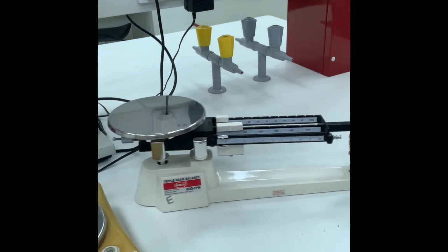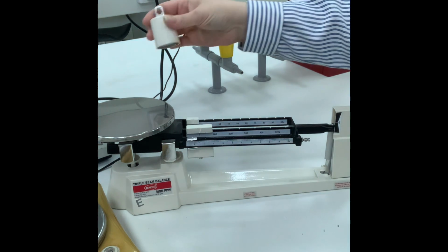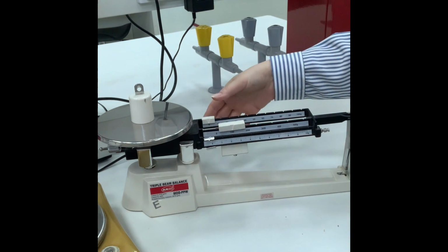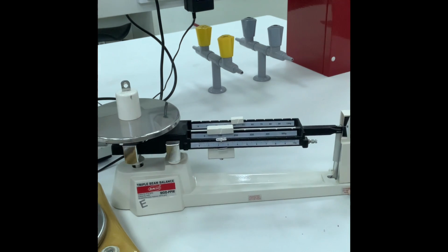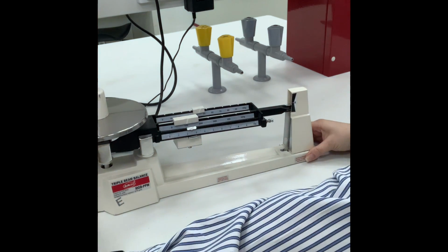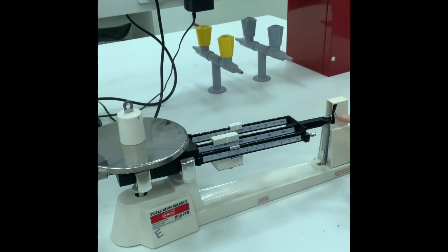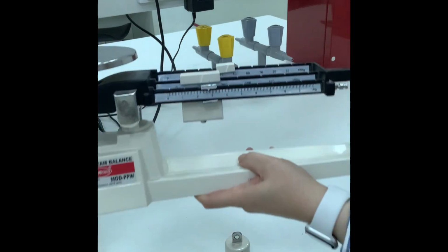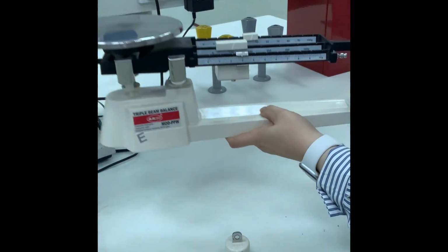So you have to measure the weight of a metallic block. This is the metallic block. Very simple. I will just apply it. And with different weights over here, I need to balance the ruler. Let me just show you, it's very big. I believe you can see it right now, all together. Yeah. I need to balance the ruler over here to the 0. I will show it to you right now. These are the different weights, and this is the 0 where I have to balance it, okay?